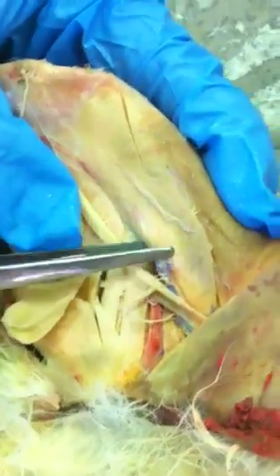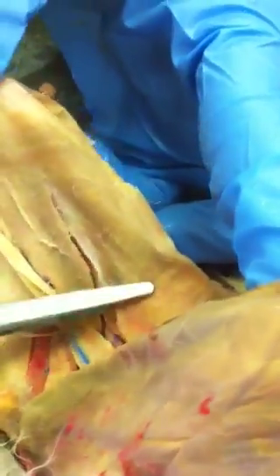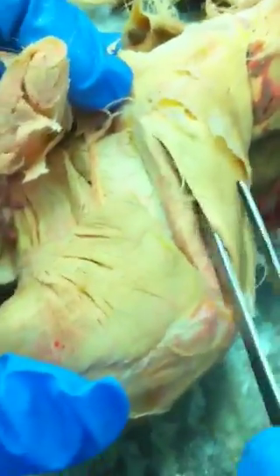And then on this side we have the vastus medialis. Then this sheet here is the tensor fasciae latae — this whole sheet goes all the way to the dorsal side. And then this is the vastus lateralis, this whole piece.